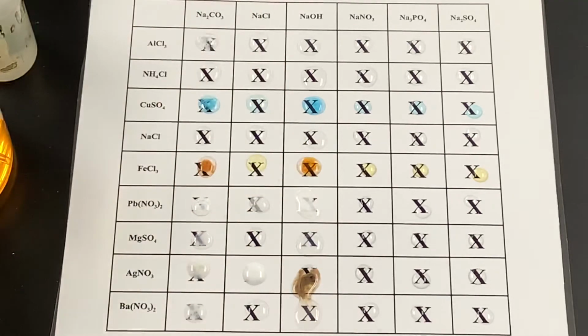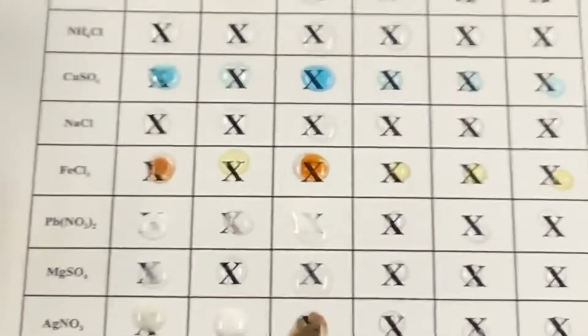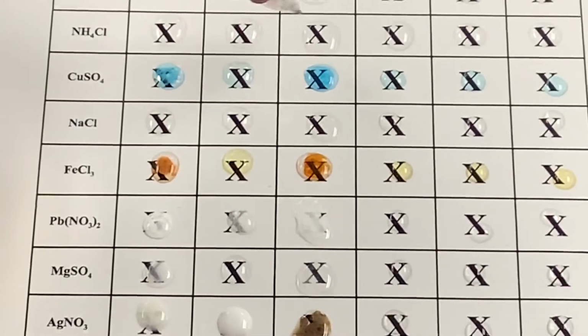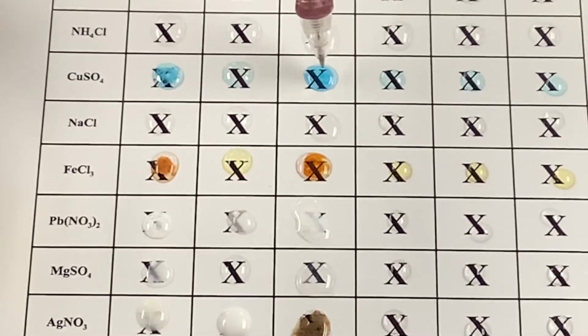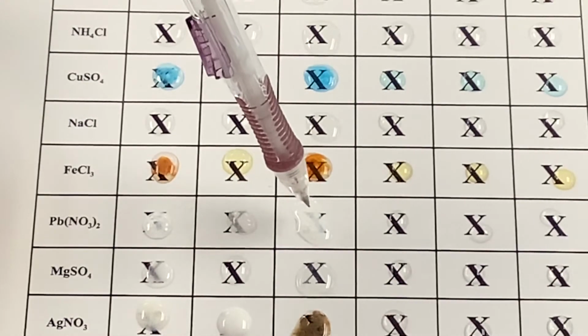Oh, getting a little mix in there. As far as this one goes, it's a little difficult to see, but we saw that this X here for the copper is getting a little bit of precipitate. It's just not directly over the X, so from your point of view it's a little harder to see, but right over on the side here, I do see some solid. Not a lot, but there's some. We see some solid here, definitely, yes.